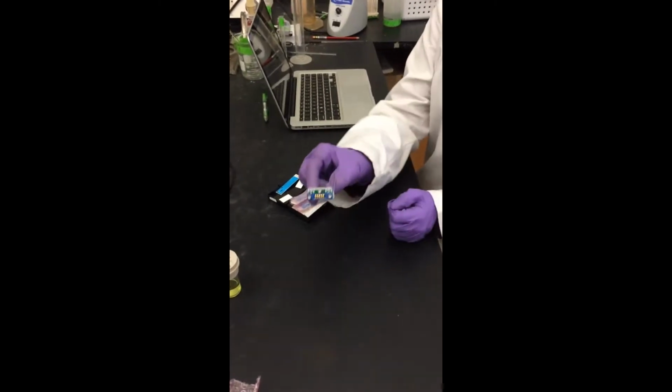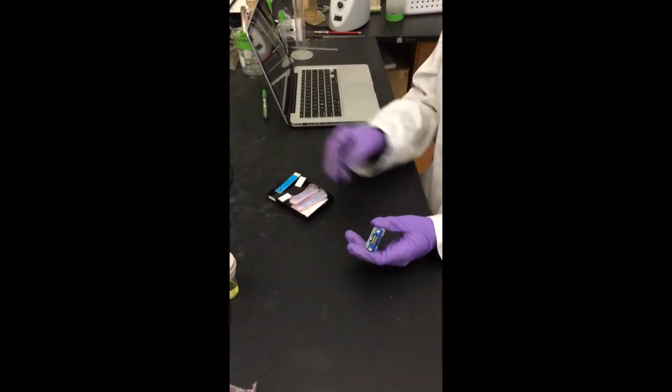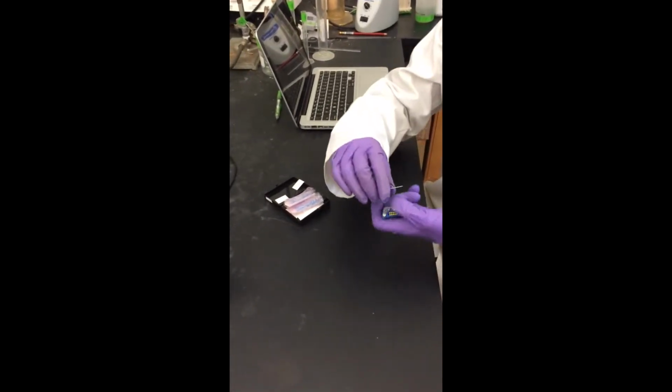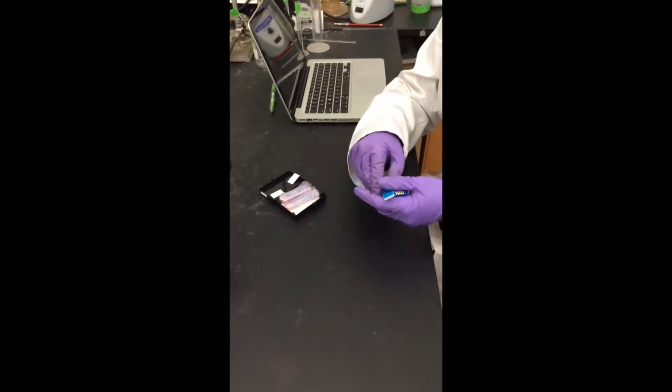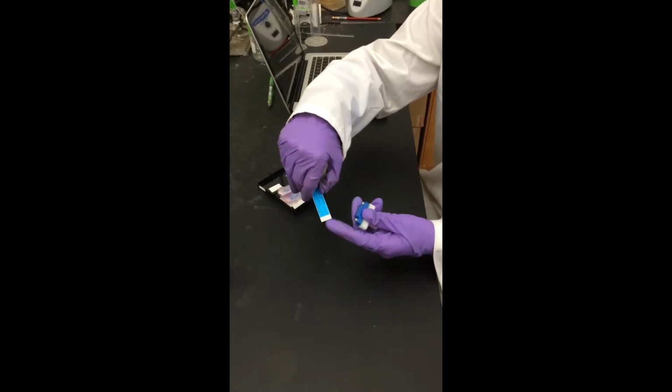This is the cell adapter that is used as a cap for the cell chamber and attaches to the screen-printed electrode. From the small black box provided in the Wave Now setup, we pick a blue screen-printed electrode. These electrodes are relatively inexpensive and are therefore good for initial experimentation.